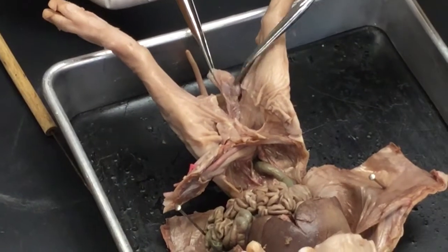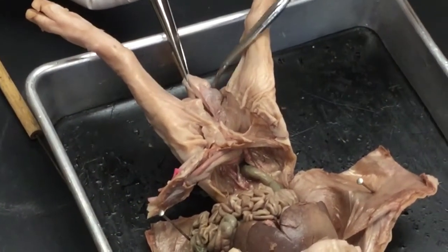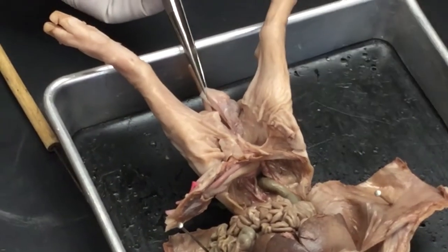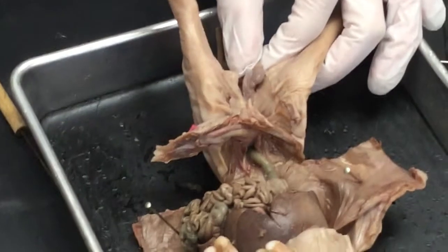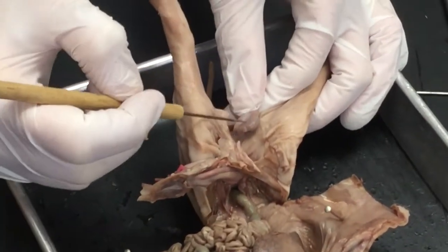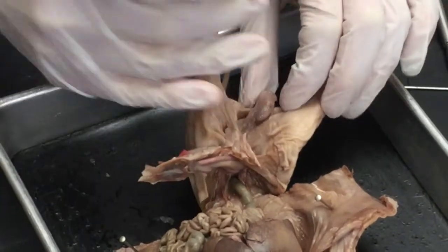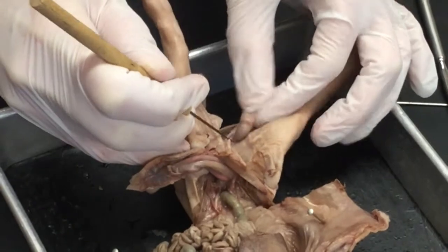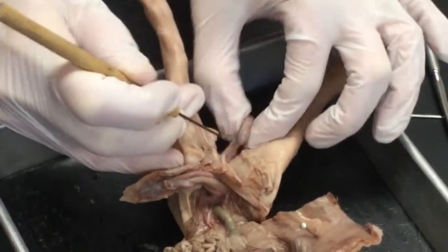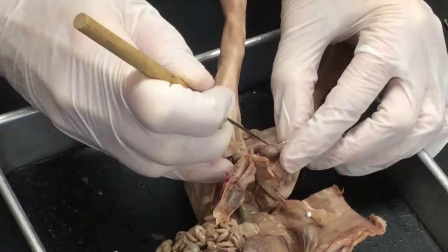You might be able to see this bean structure here. This would be the testis, but it's covered in a film as well. So I'm going to remove that film. And as I remove that film, I'm going to expose the epididymis. The epididymis is a bunch of coiled tubing, it should remind you of the female a little bit. This is a little bit tedious because it's very slippery.